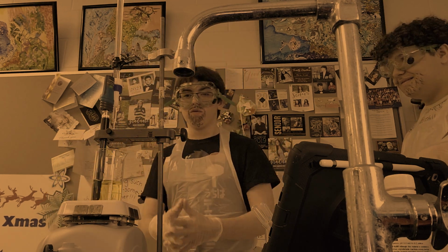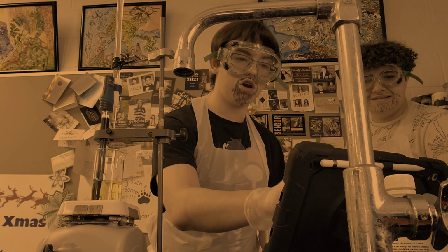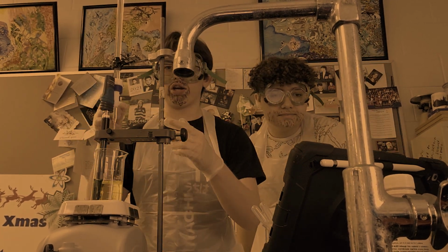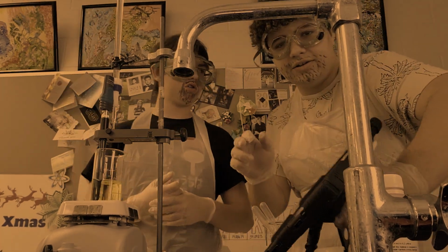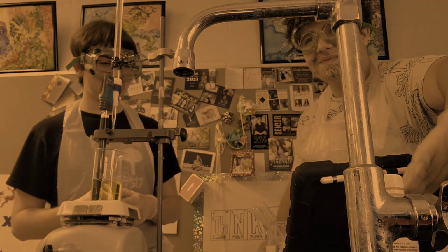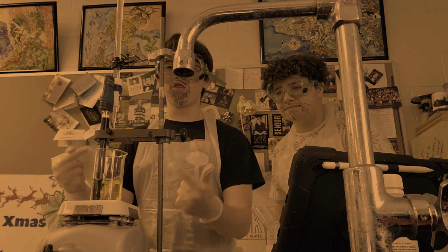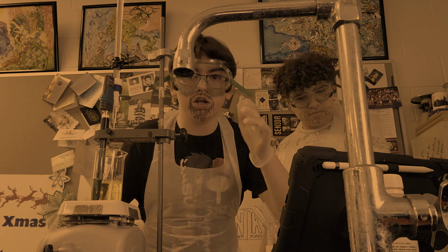And so, now, what we're going to be using is our drop counter, which is able to give us an approximation of how much we're putting in. We're also going to be using our burette, so we will also be measuring how much is dropping into the beaker. Look, the line's blue. Just like something else. Our ultra pure Jesse. And so, now what we're going to be doing is dropping into this beaker while stirring.